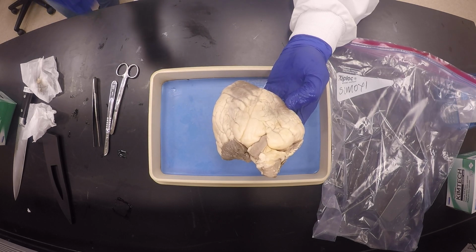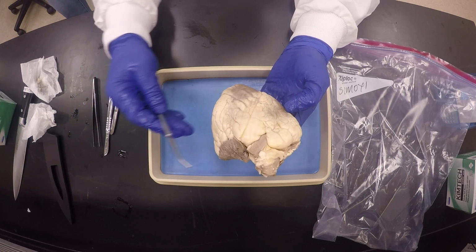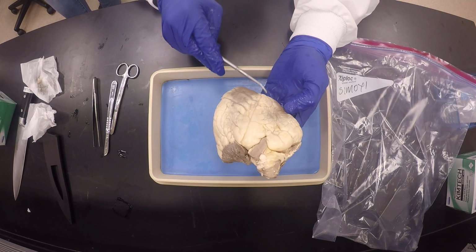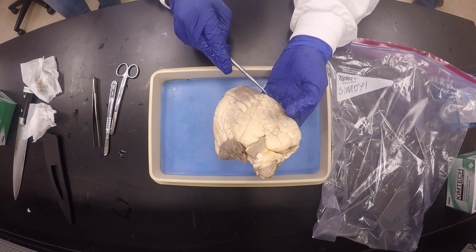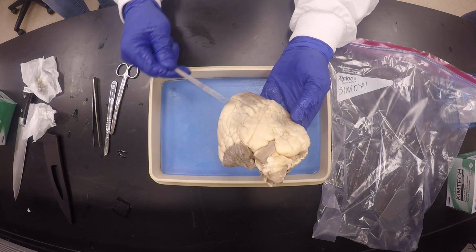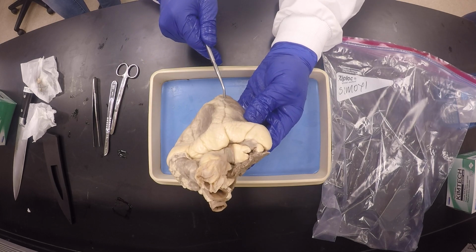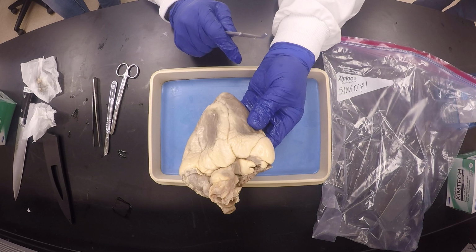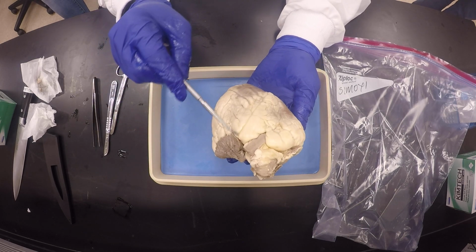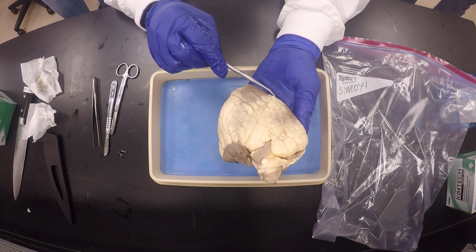That's why I call it the anterior interventricular sulcus, because it's going to be sloping from the left side going to the right side. And then this will be the left ventricle. So this is the anterior. The posterior one is straight, it's vertical. So this is the back of the heart.